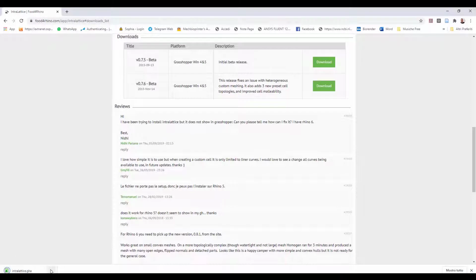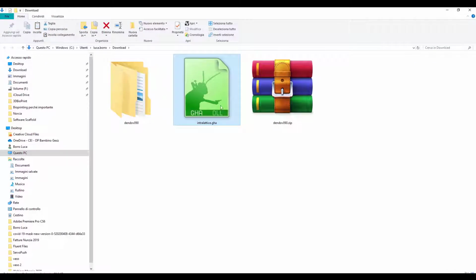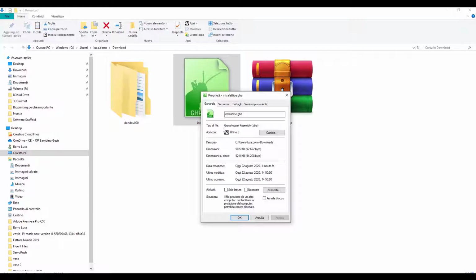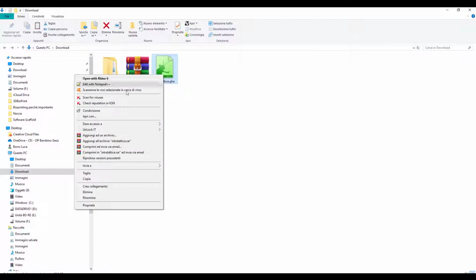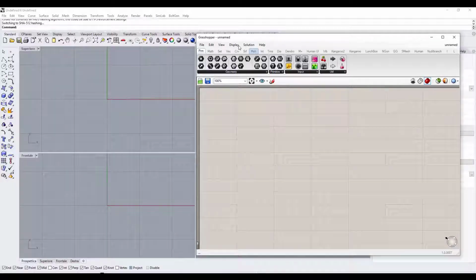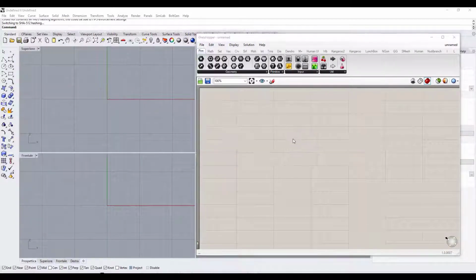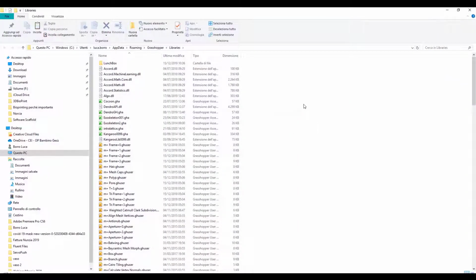What we have downloaded is a GHA file. A GHA file is the component file for Grasshopper. Now we go into the directory. We right click on the file and select properties, and we check the unblock option in this window. Click OK. So we right click on the IntraLattice file and select copy. We go back to Grasshopper, click on File, Special Folder and Component Folder. Now we paste the file into this folder.